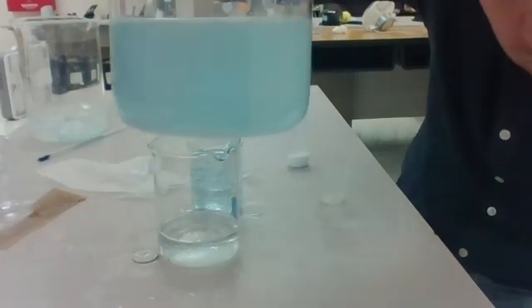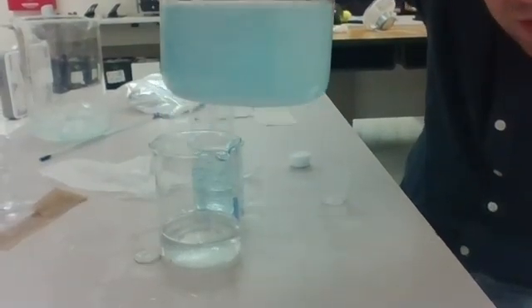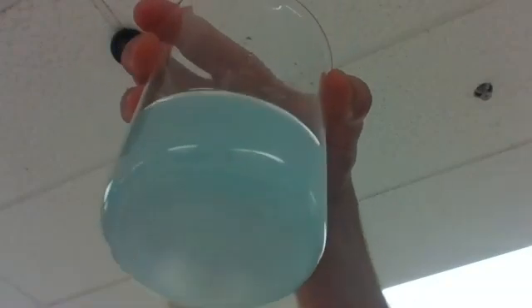And we see that the majority was able to dissolve. Let me turn the camera up. You can still see there's a little bit of salt at the bottom that didn't dissolve. That might be because water reached its saturation point. It's possible that it was too much salt to be able to dissolve, but actually when I gave it another stir, the salt is pretty much all dissolved.